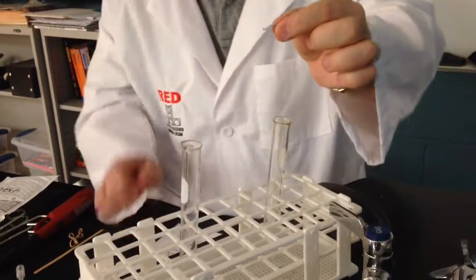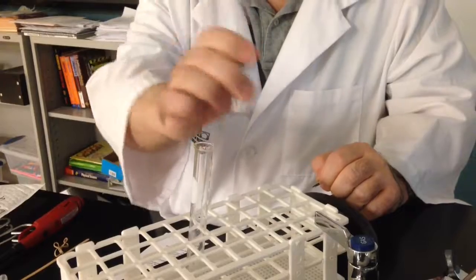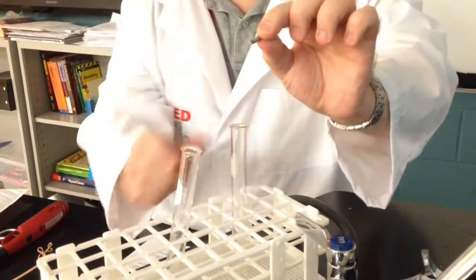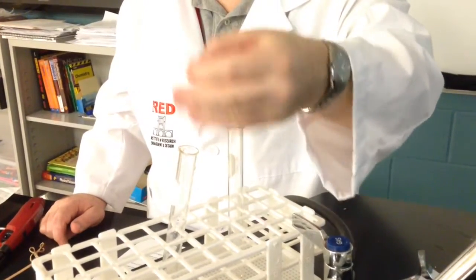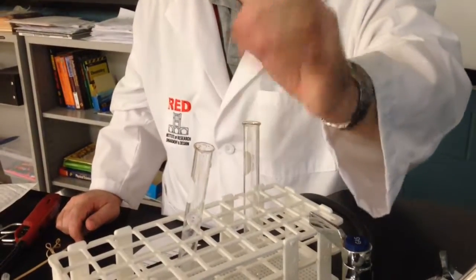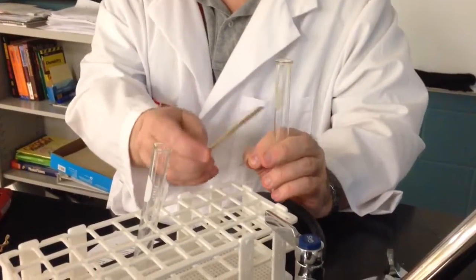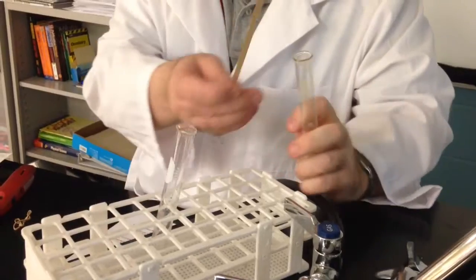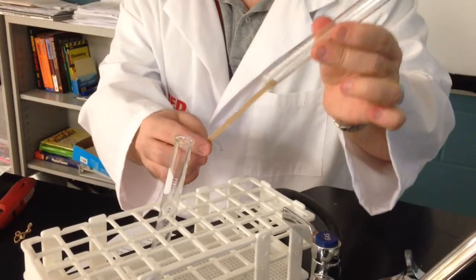tube. What we'll do, we'll put the magnesium into the test tube of hydrochloric acid, and very quickly and immediately we'll invert an empty test tube and capture the hydrogen gas that will be evolved. The magnesium will replace the hydrogen in the hydrogen chloride, and then the hydrogen gets bumped off and given off, and we're going to see what effect the hydrogen will have, or what effect we'll get when we take a lit wooden splint, and after about 30 seconds of capturing our hydrogen gas, we'll take a lit splint, insert it into the mouth of the inverted test tube, and see what happens.